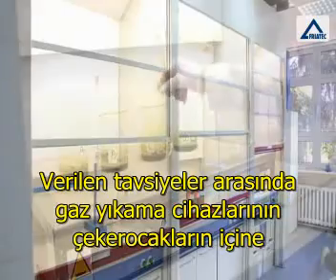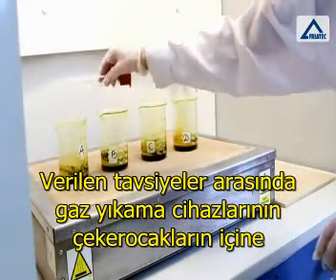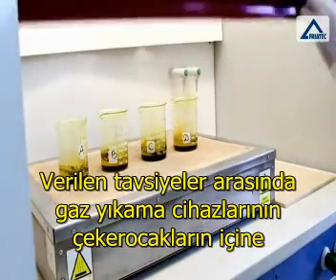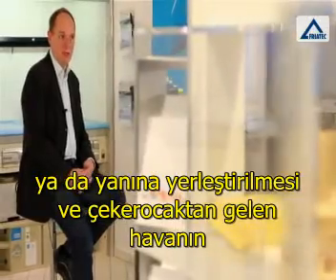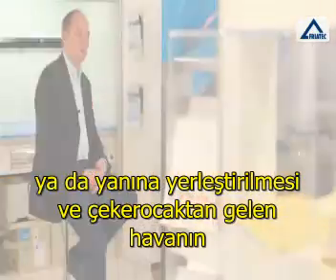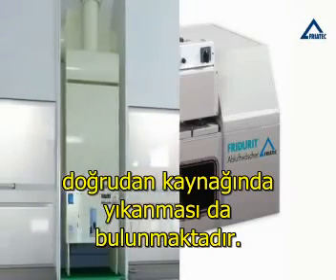The recommendations also include that fume scrubbers should be built into these fume cupboards or placed beside them to wash out the air coming out of the fume hoods directly at source.